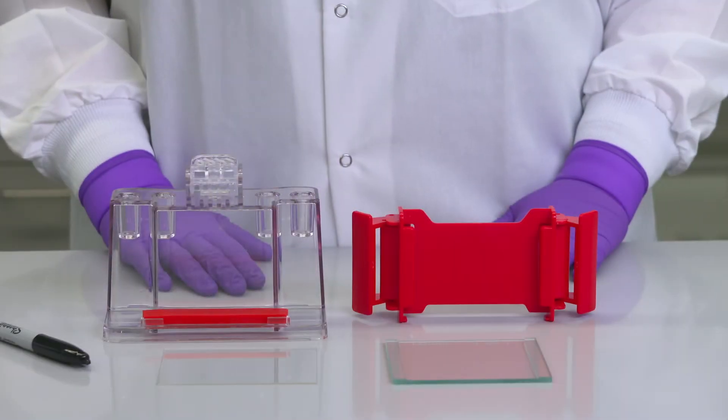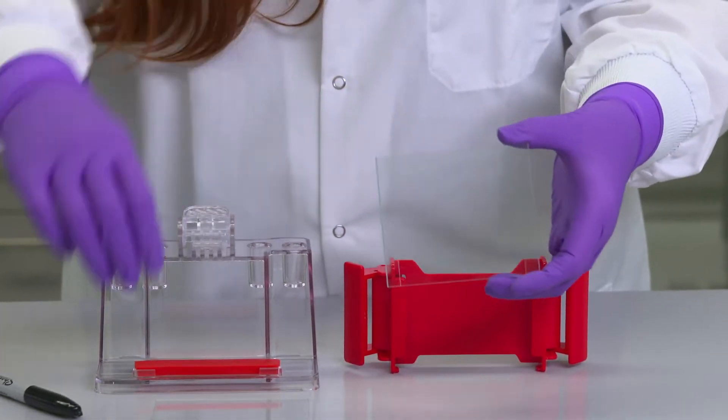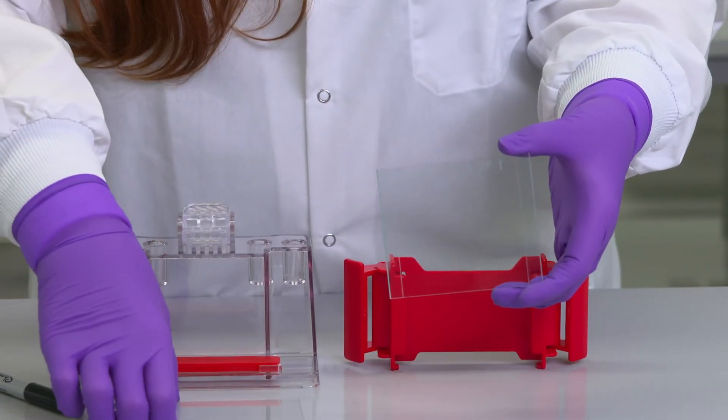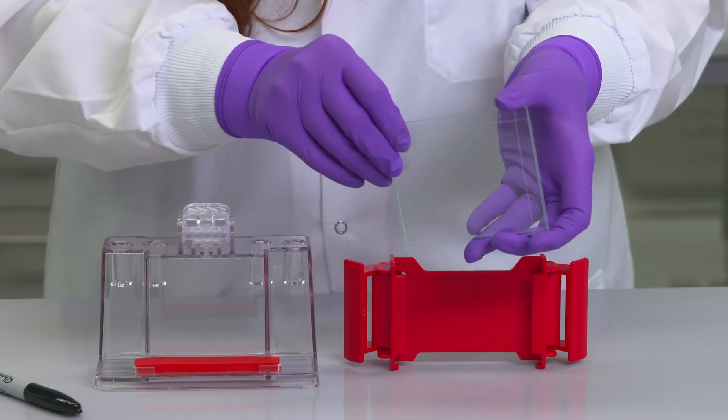Before I start I'll assemble my casting stand and cassette making sure that the plates are free of any chips that may cause leaking. These solutions can be used with any individual casting equipment.